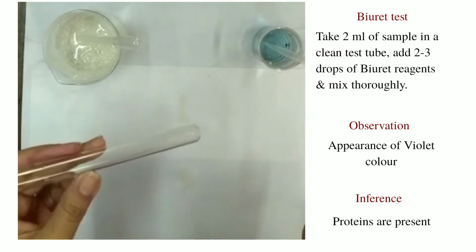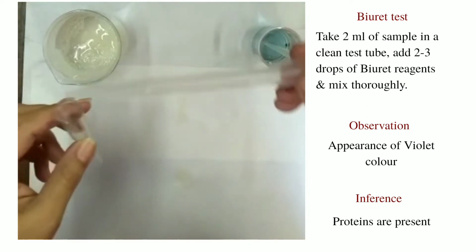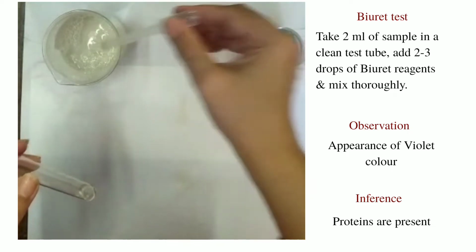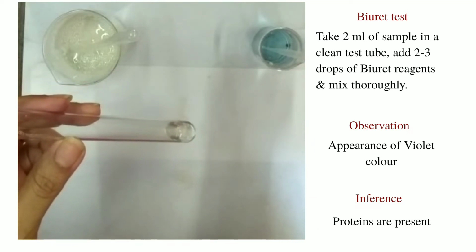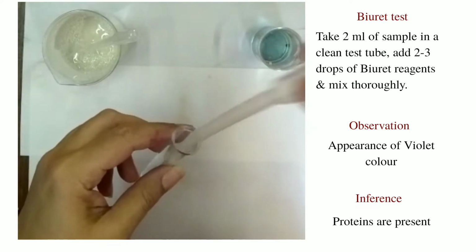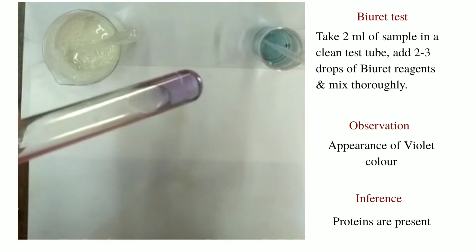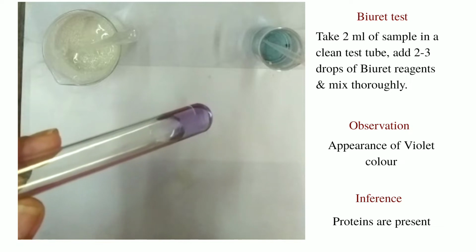We'll do the tests now. First test is Biuret test. In a clean glass test tube, take about 2 ml of the sample. Add Biuret reagent. You can see Biuret is light blue in color. As you add, keep shaking the test tube and shaking the contents. The solution turns purple. So this indicates the presence of proteins.